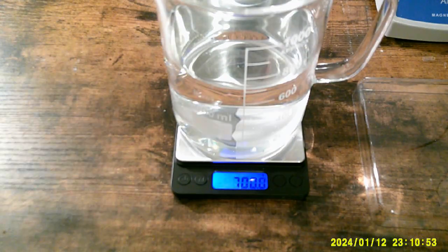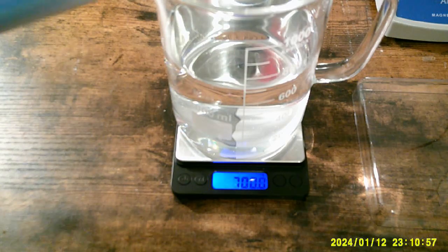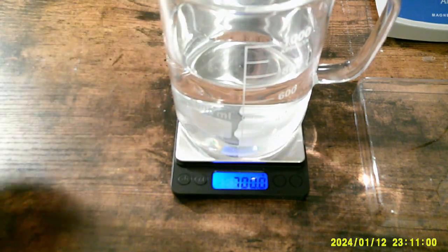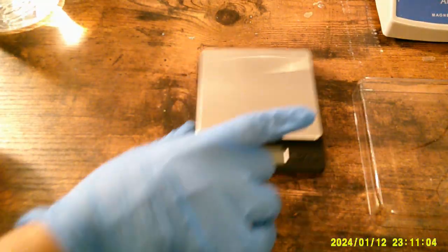I need to add in 140 grams of copper sulfate pentahydrate. You're going to have to trust that I've already measured this, but I have. That's exactly 140 grams, which will leave me with a solution that has 20 grams of copper sulfate per 100 grams of water, which is a solution that is not saturated but is not diluted enough to not work. As an added bonus, it's not going to drop out copper sulfate when it gets really cold the next few days.